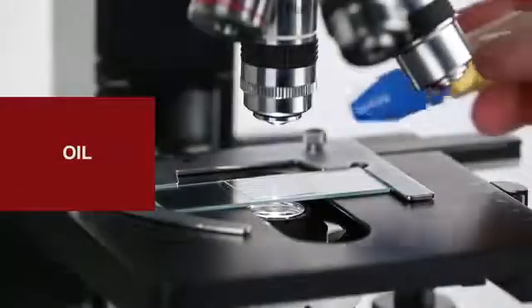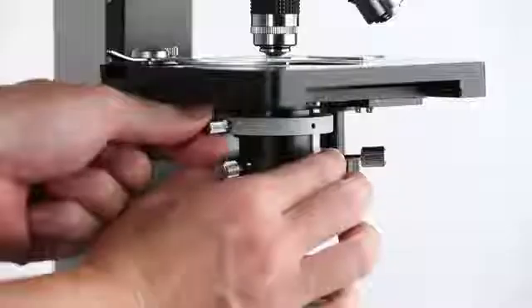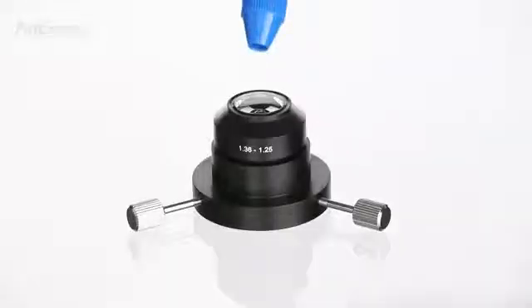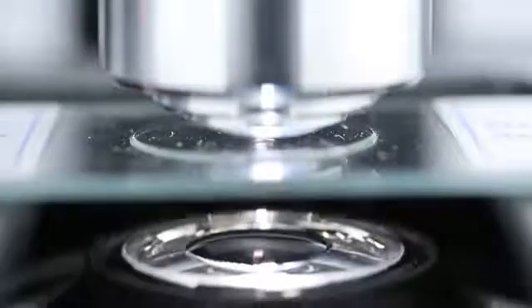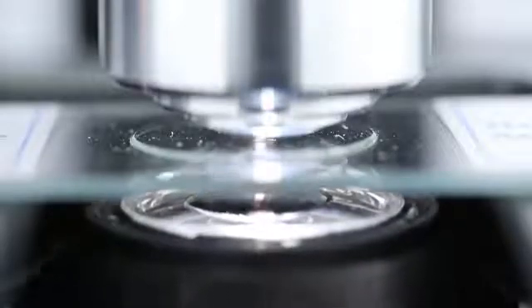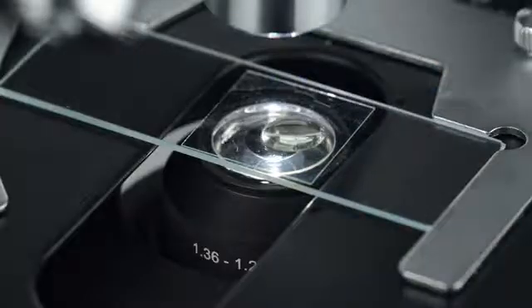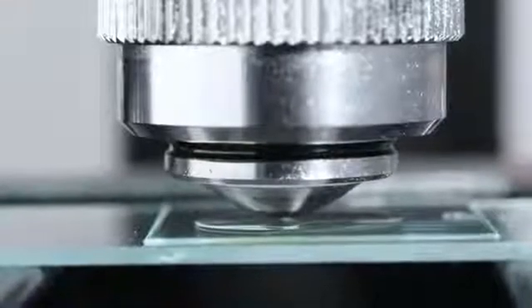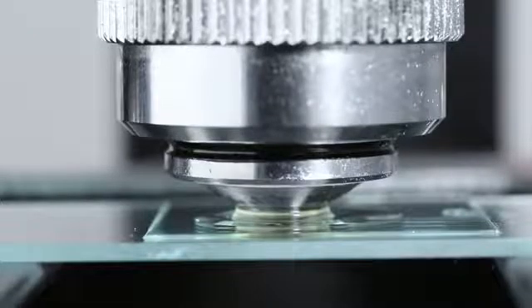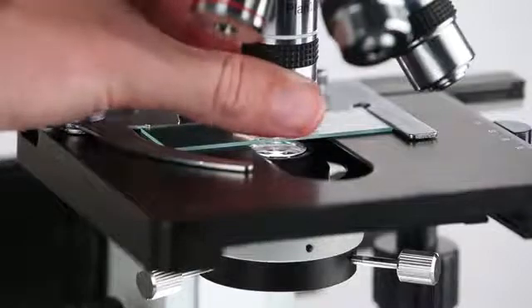When working at high magnification, you'll likely be using an oil objective lens and an oil condenser. Before using an oil condenser, apply a drop of oil to the condenser's lens. Once the condenser is installed, raise it until the oil makes contact with the bottom of the slide. If using an oil objective lens, apply a drop of oil to the cover slip, then gently raise the stage until the oil makes contact with the lens. Now you can fine-tune the focus. If using a variable aperture lens, adjust the iris to fine-tune the contrast.